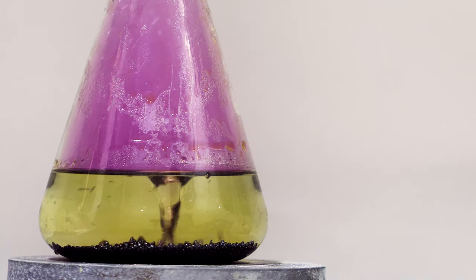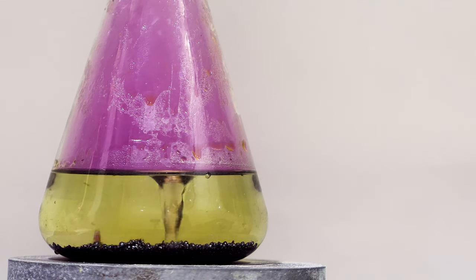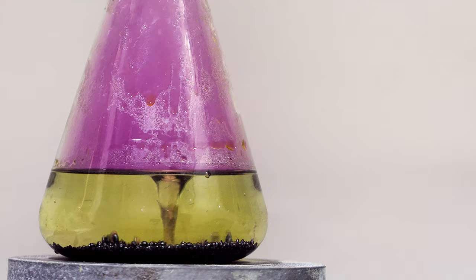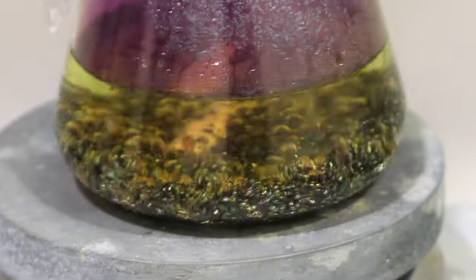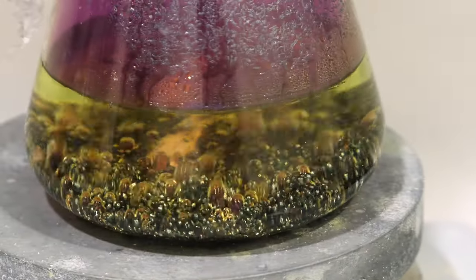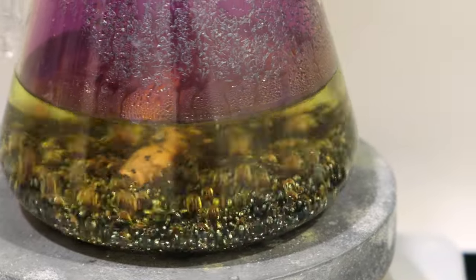Immediately the reaction starts to take place as the color of iodine dissolves into the water. Apart from that, there is some gas generated on the surface of iodine, creating this bizarre motion.